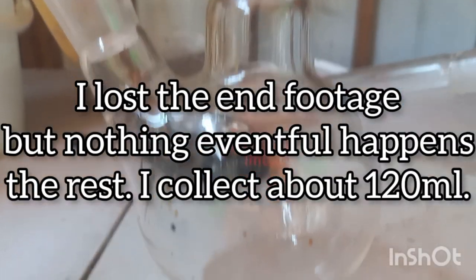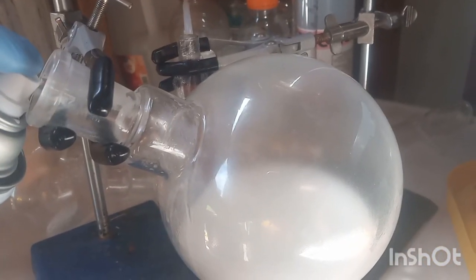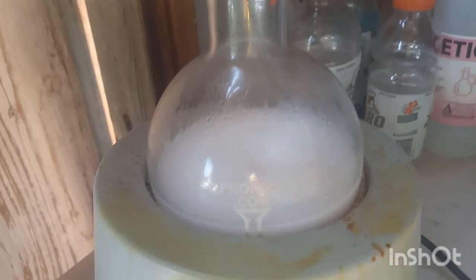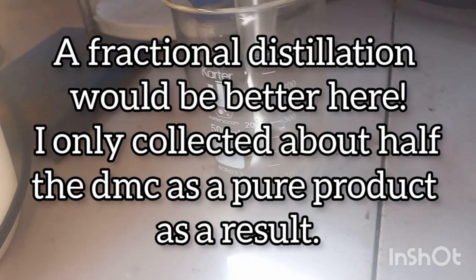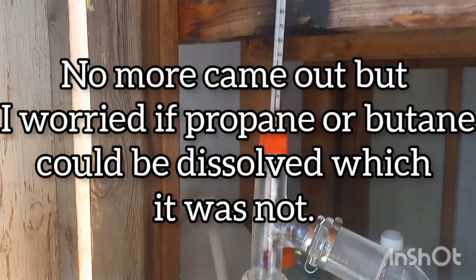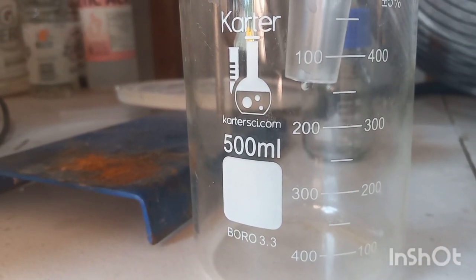Building up, and we'll get some drops soon. Here we go, I just switched over.